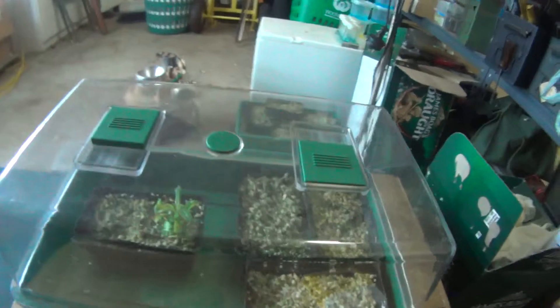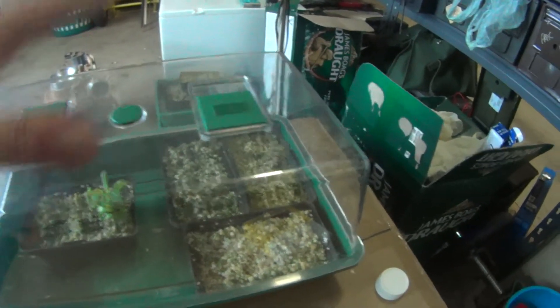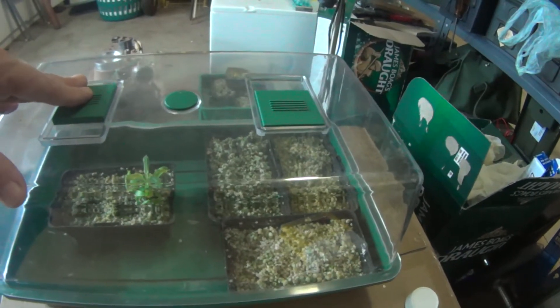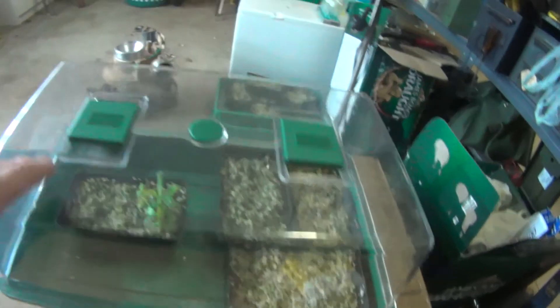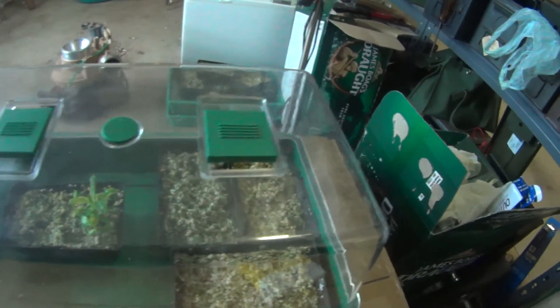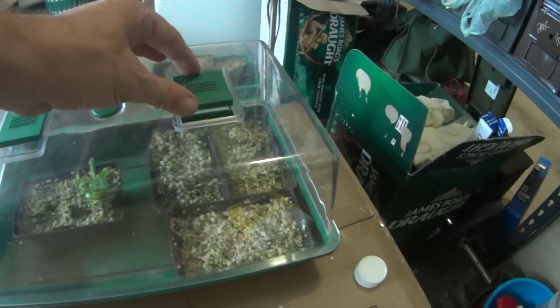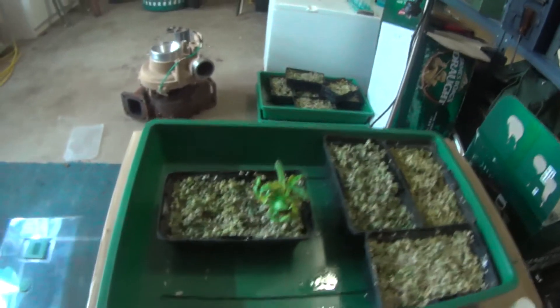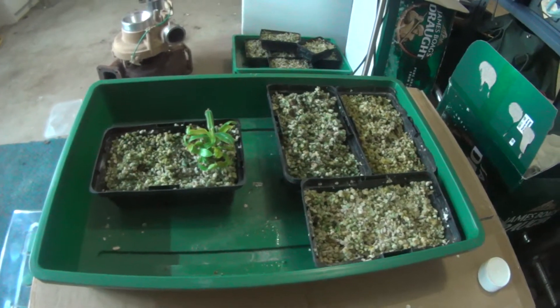For the first week, just put your plants in them. Don't expose them to direct sunlight yet — that'll cook them. So for the first week, keep them in a shaded environment or under grow lights if you have the space. Then maybe after a week, slowly open up the vents. Take the lid off and give it a good exchange of air every now and then as well, but make sure you put the lid back on soon afterwards. After a week, open up the vents somewhat to let a little bit more air in. It depends on your environment — up here it's fairly humid anyway, so I can get away with opening these up a fair bit more. But in a dry environment, I'd keep them shut maybe for another week, just slowly exposing them. Eventually you can remove the lid and the plant hopefully won't dry out and die on you. Then you can transplant it from this into the potting media and place it in your normal growing area.